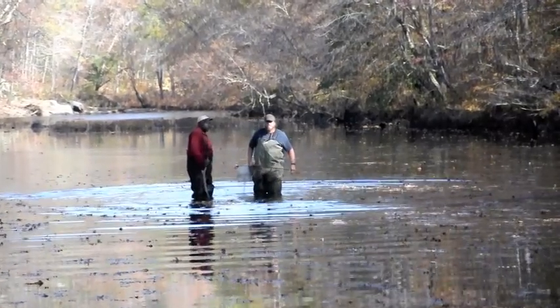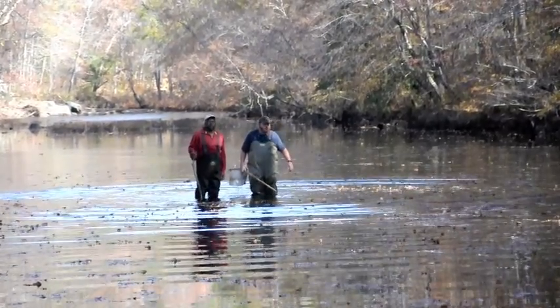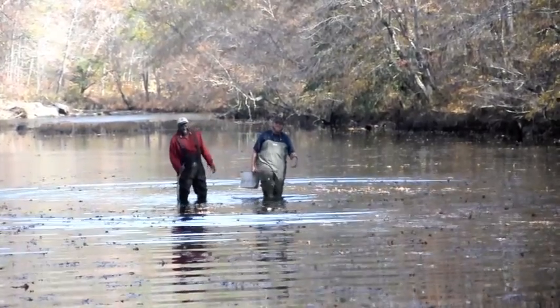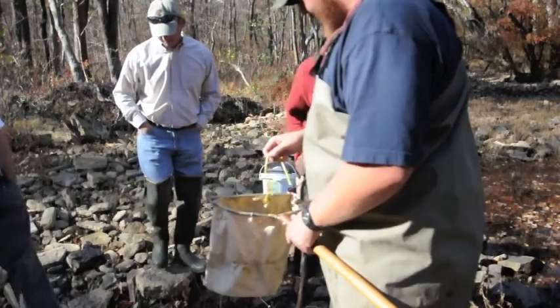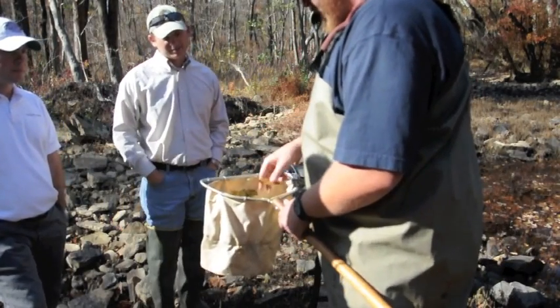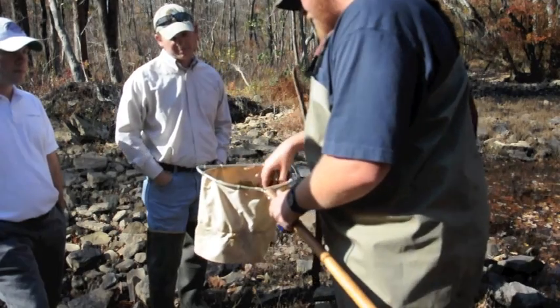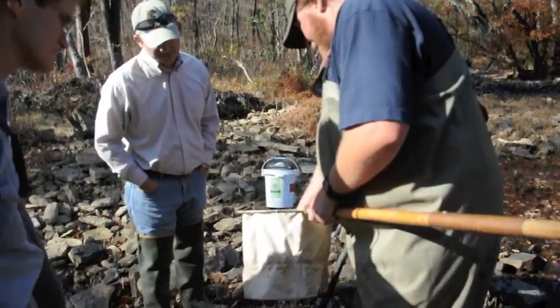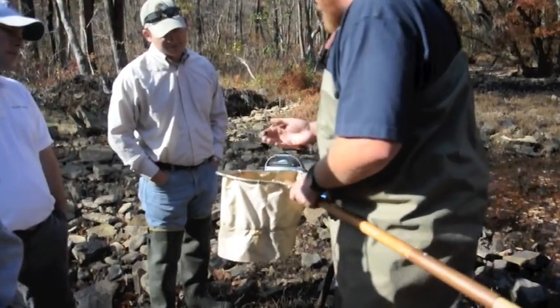Hey Jason, what's the name of that Ozark dancer doing there? The Bedrock Boogeyman. Some groups like — you got green plant matter, you got detritus, dead plant matter, and then you got all this good mud right there which will hopefully be full of a lot of stuff.